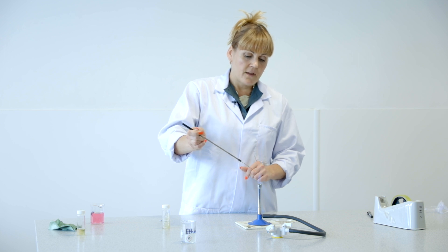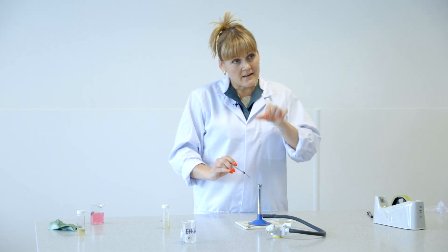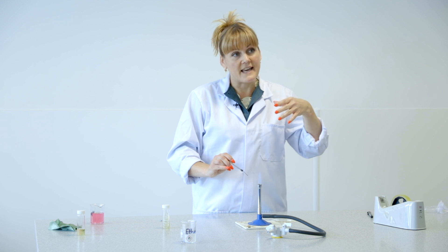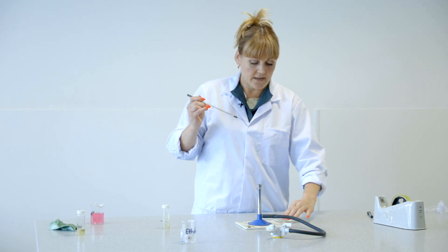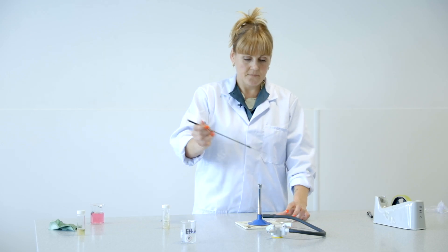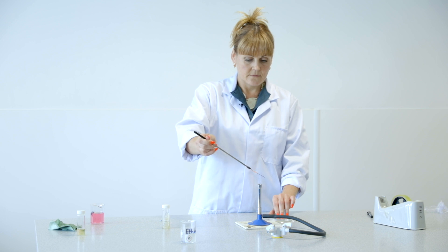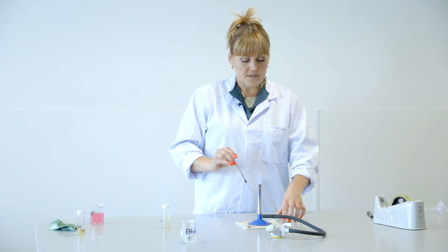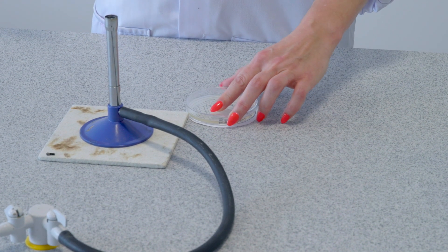The idea of the streak plate is that you make streaks coming out of that well, and each time you streak you drag fewer and fewer colonies into the next stage, until ultimately at the end you get separate colonies. I'll sterilize, then turn it and drag three lines carefully from the well, turn it in readiness, and again drag some of those colonies across. There will be fewer colonies present with each stage.